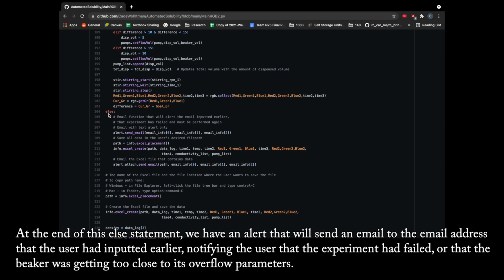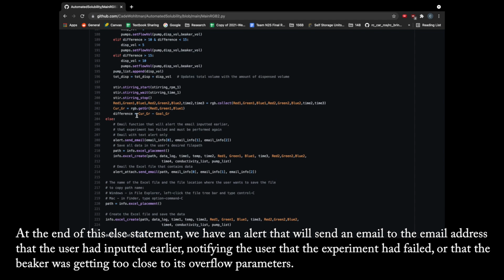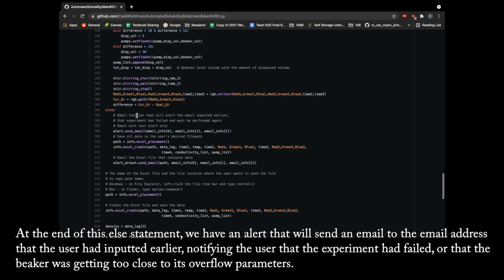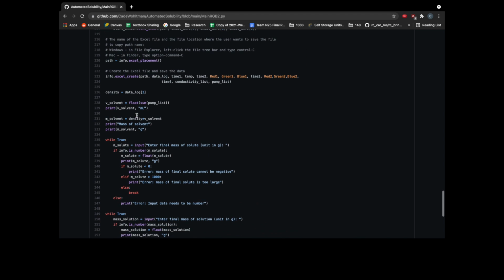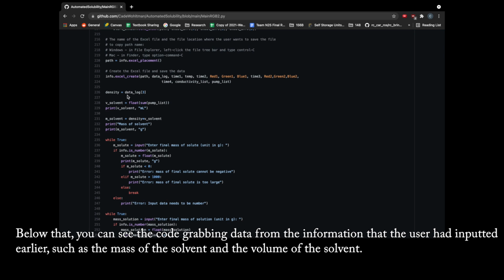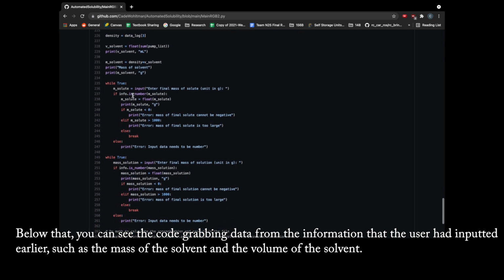At the end of this else statement, we have an alert that will send an email to the email address that the user had inputted earlier, notifying the user that the experiment had failed or that the beaker was getting too close to its overflow parameters. Below that, you can see the code grabbing data from the information that the user had inputted earlier, such as the mass of the solvent and the volume of the solvent.